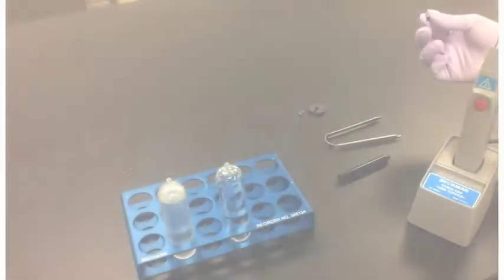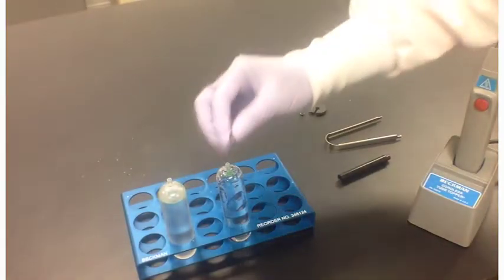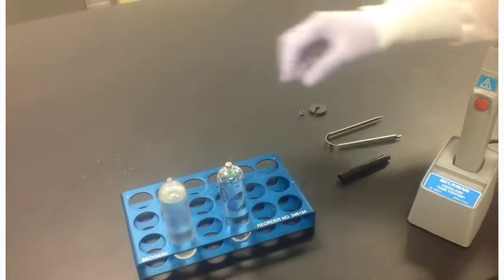Place the seal former on each tube stem. Seal the tube using the preferred seal guide method.